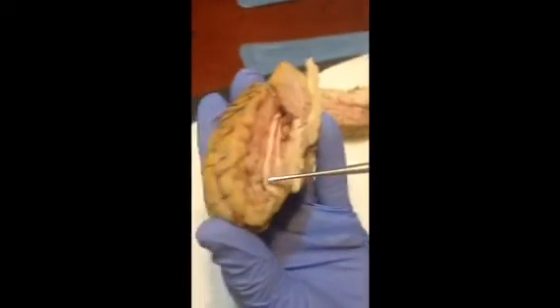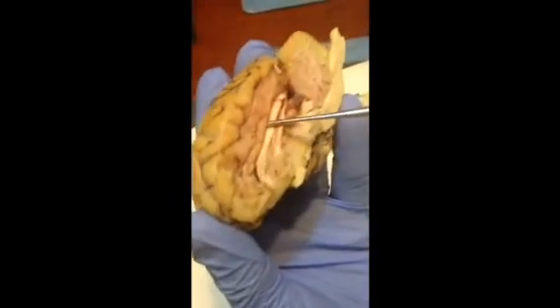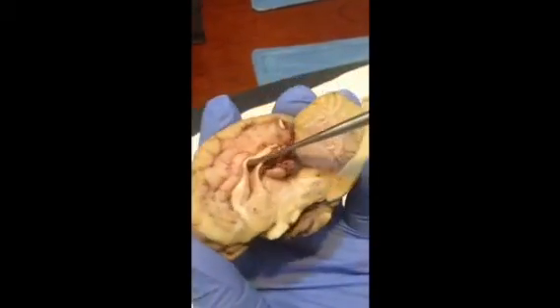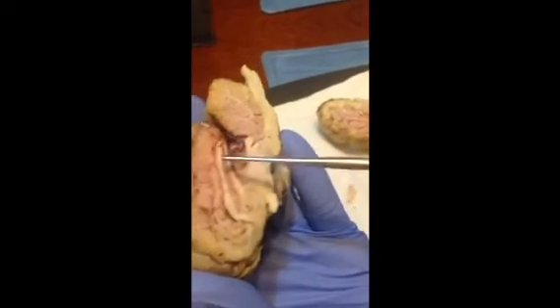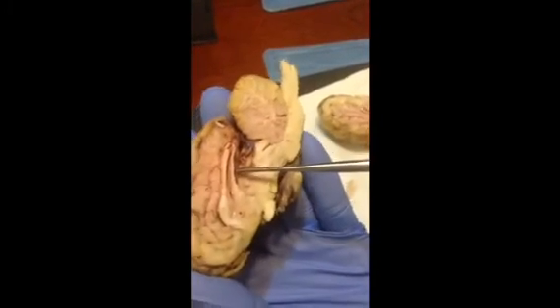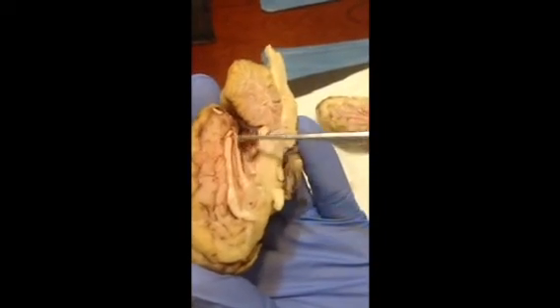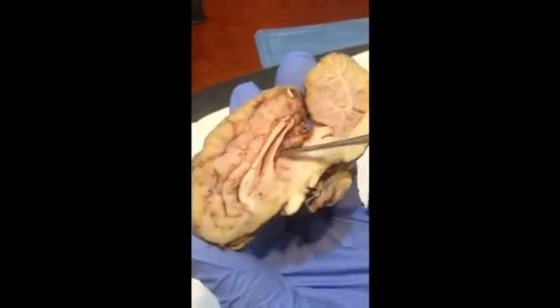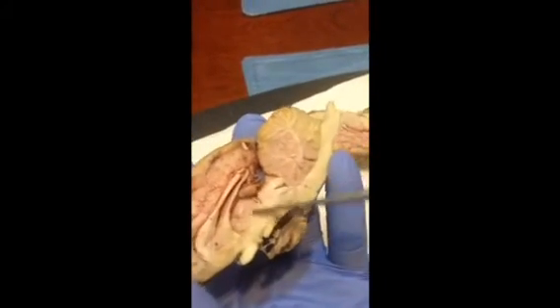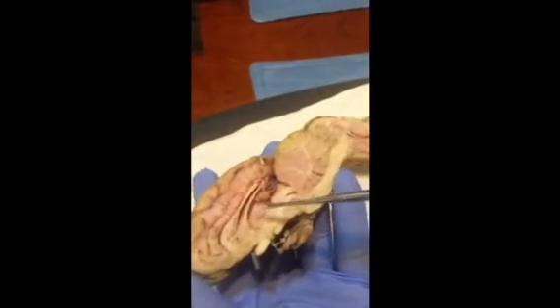Continuing with the sagittal section of this sheep brain is the corpus callosum here. It's the arc right in here. Over here is an opening, which is the lateral ventricle. Above, between the corpus callosum and the lateral ventricle is the fornix. The thalamus is a well-formed big circle right here. Remember, it's a big circle. It's responsible for a lot of things.